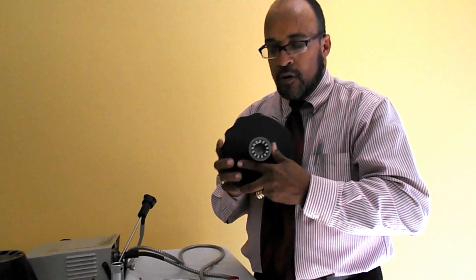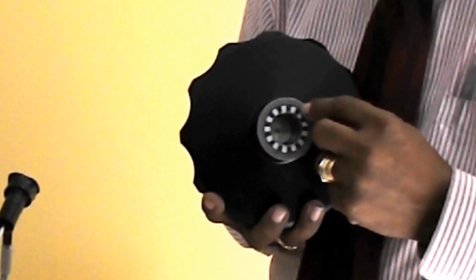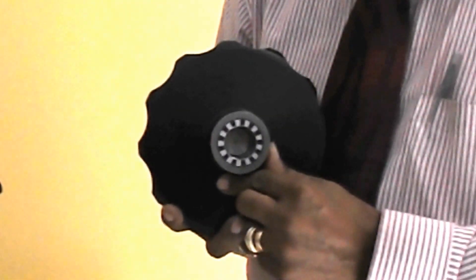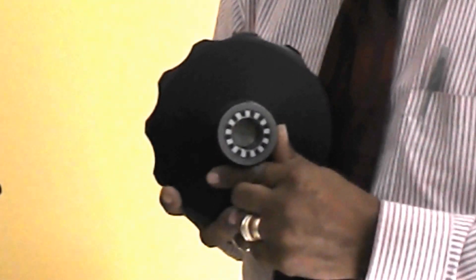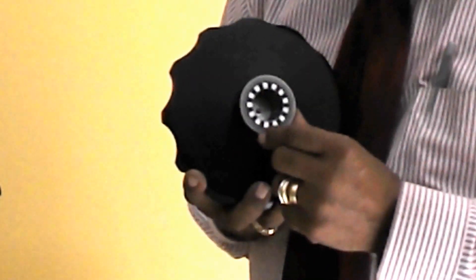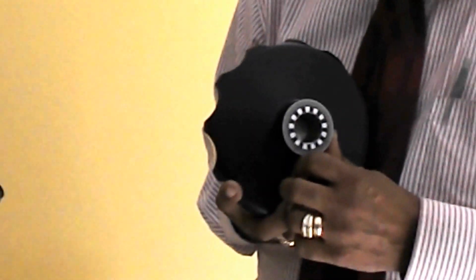Under the bottom is your overspeed disc. This is what tells your overspeed signal. This is where it derives from. These black and grey segments are proportional to voltages that are read inside of your centrifuge by the detector. These need to be looked at and inspected and replaced if necessary.